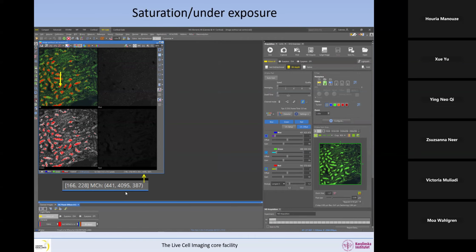So what we can see here is that the green channel, which is channel 2, has the value 4095. And even if I go to any of these red pixels, the saturated pixels, the value is the same. So this is the XY coordinate, and this is the values for each of the channels. So 4095 in all the red pixels. Of course, it's very highly unlikely, not to say impossible, that all these pixels have the same intensity in the sample.